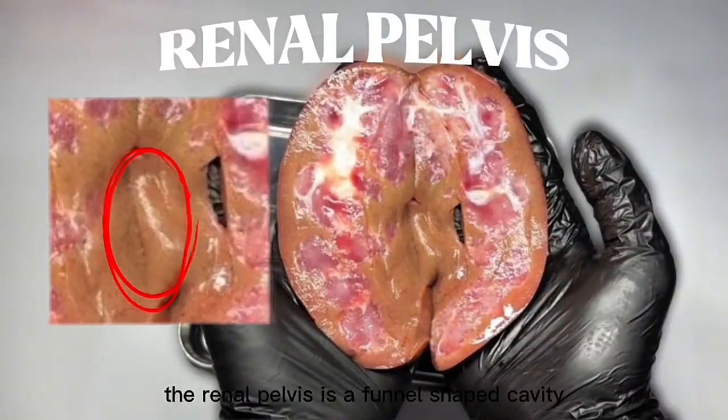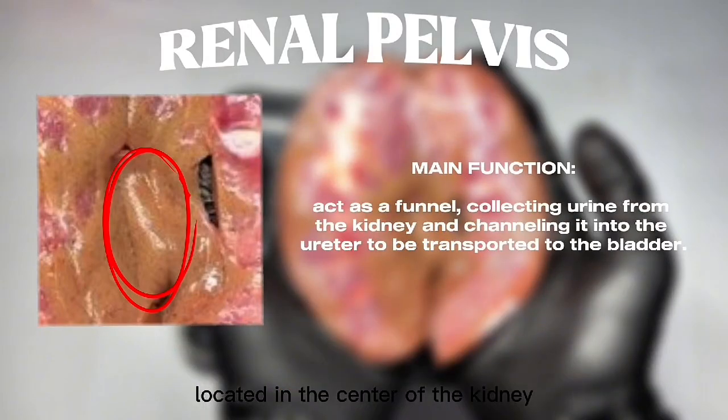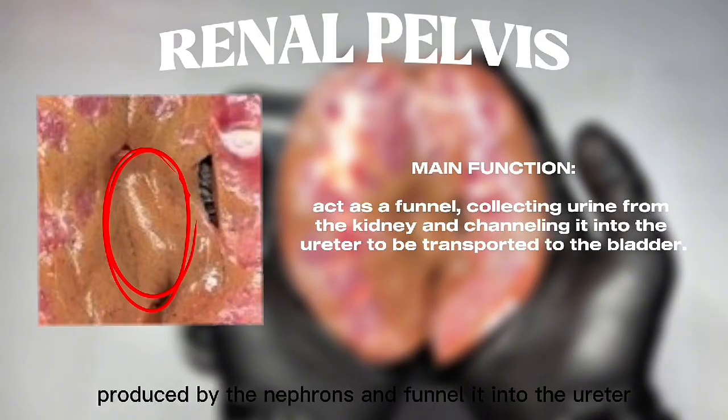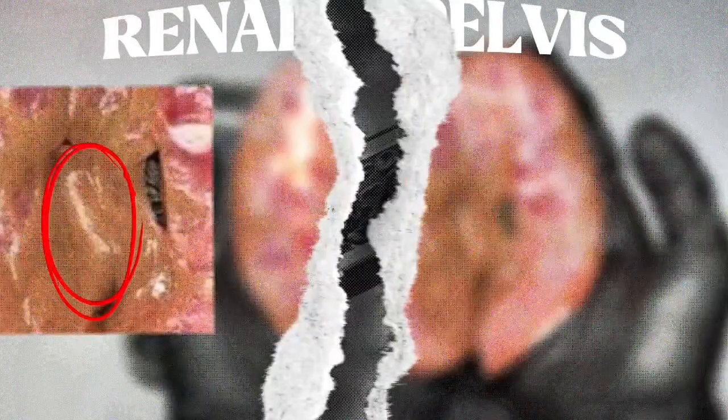Renal pelvis. The renal pelvis is a funnel-shaped cavity located in the center of the kidney, where the major calyces join together. It connects the kidney to the ureter. Its main function is to collect urine produced by the nephrons and funnel it into the ureter, which carries the urine down to the bladder for storage.